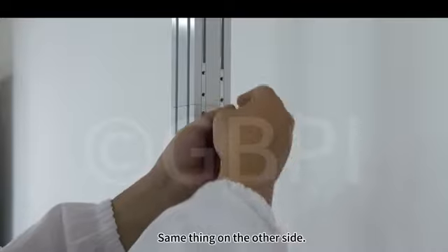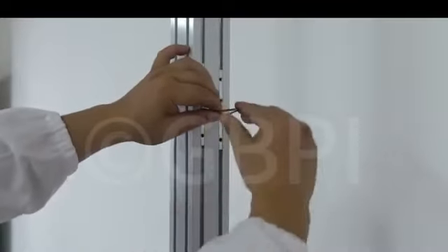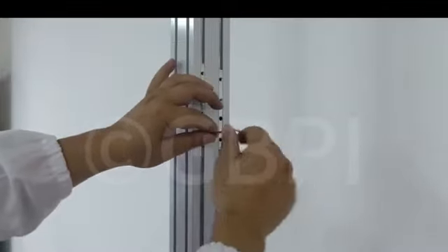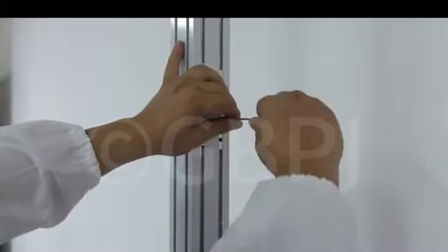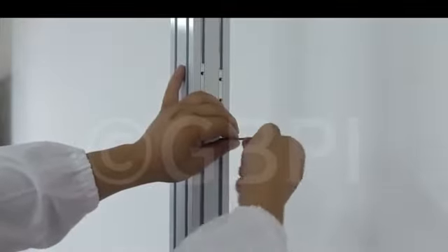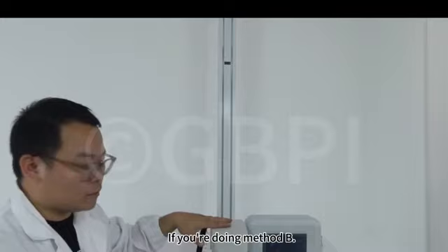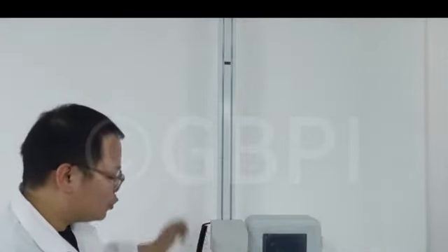Same thing on the other side. Use a screwdriver to lock the screws. If you're doing method B, loosen the 4 screws on the front end of the header holder.